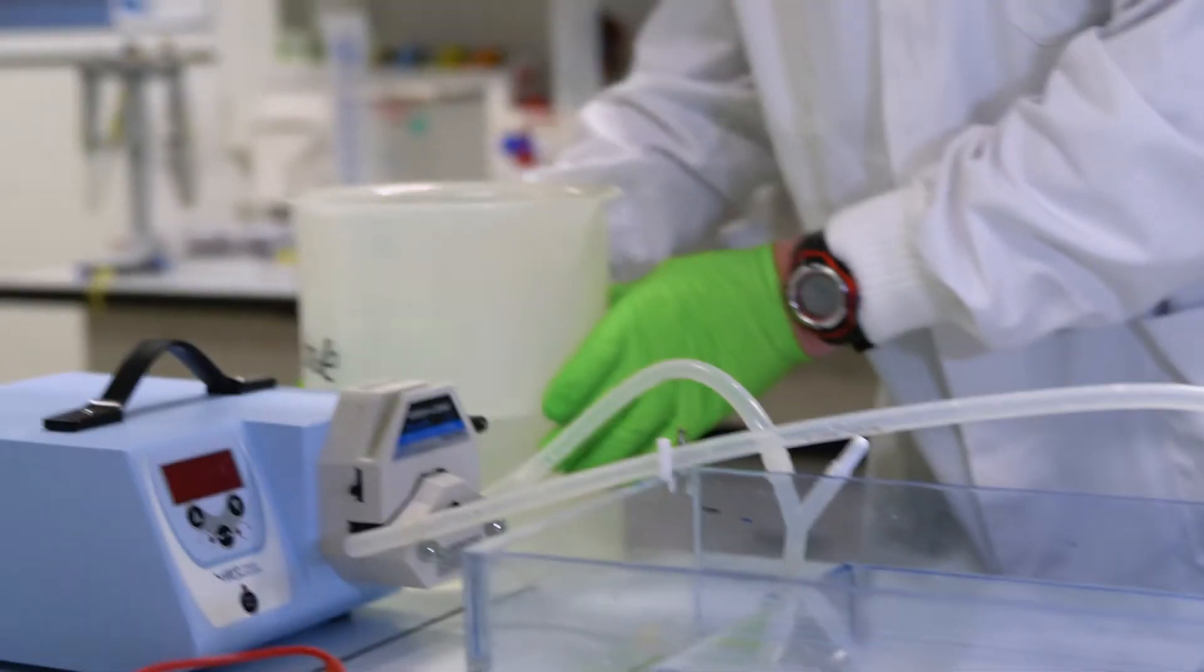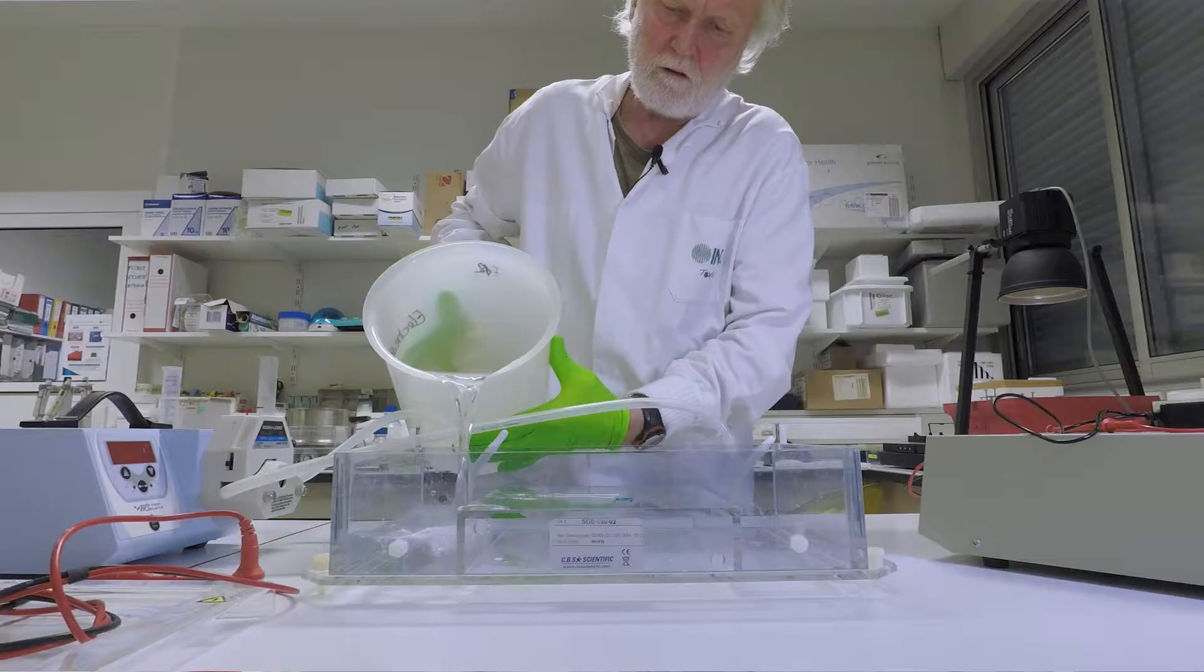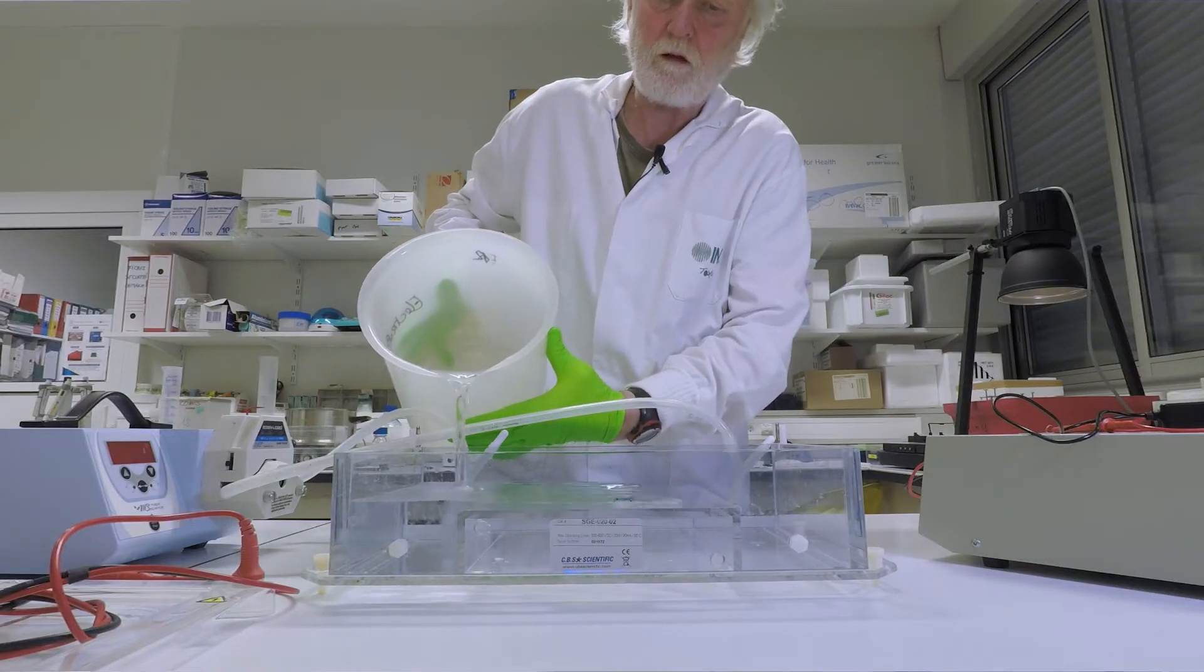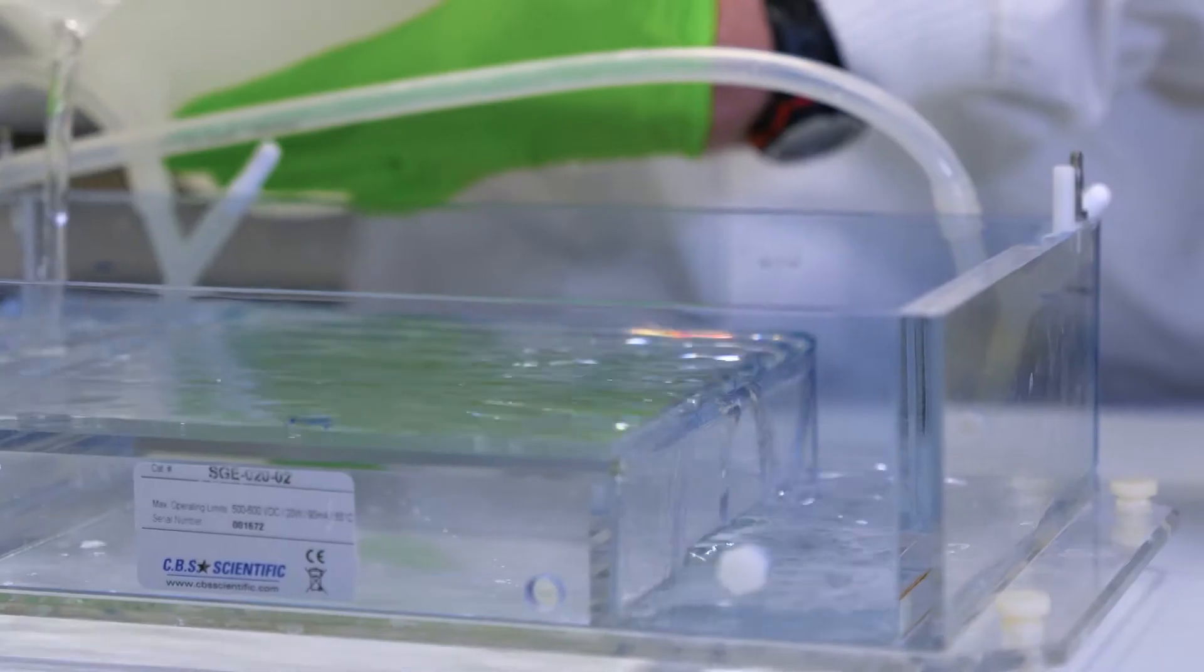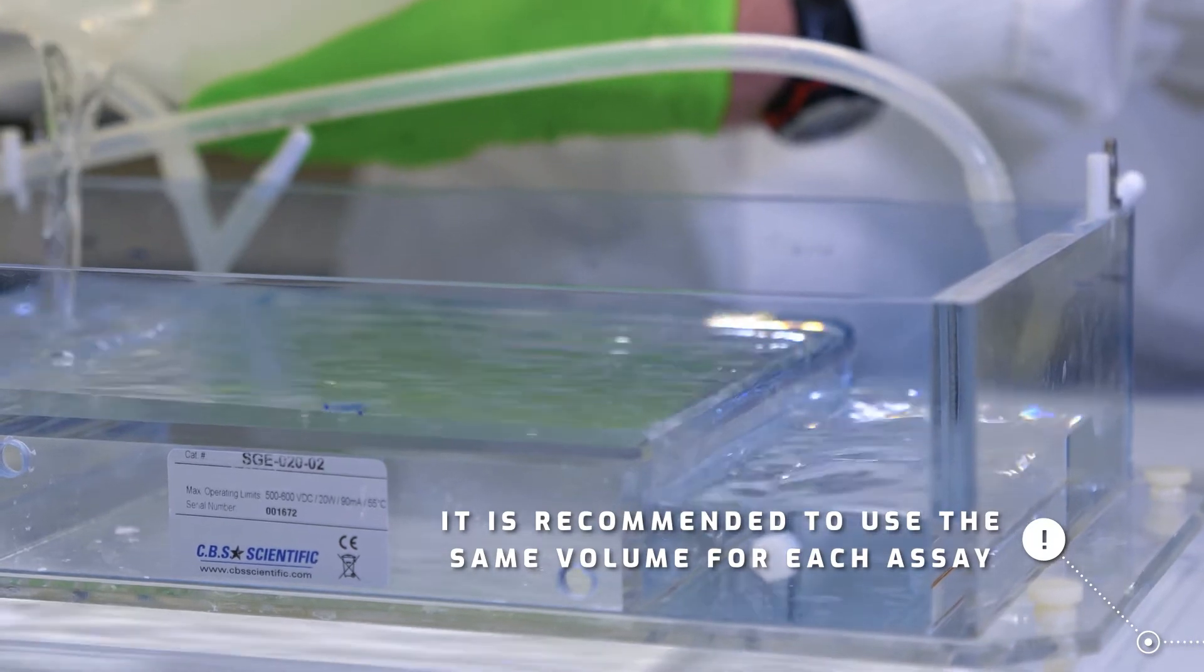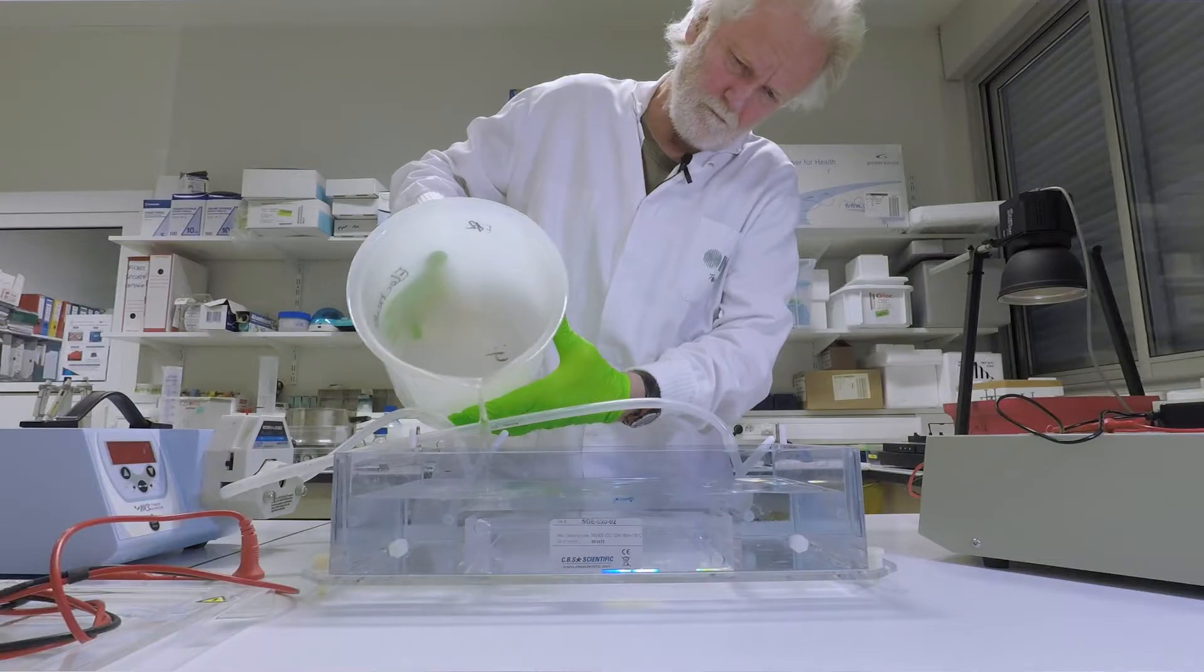So, we start by adding the electrophoresis solution. You might pour on roughly the same amount of liquid each time. And you can see we have made some sort of a mark here. And now I fill it up to this mark. That is it.